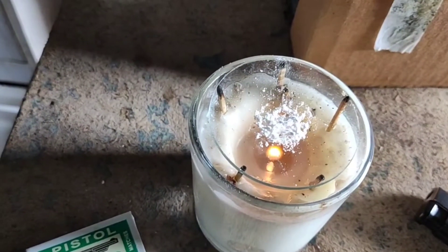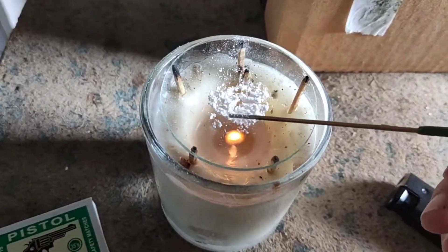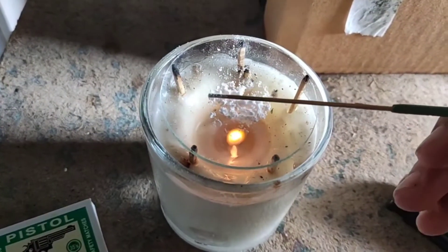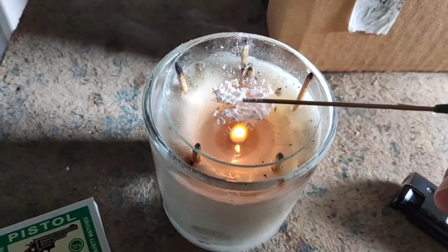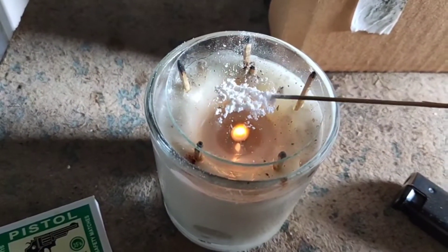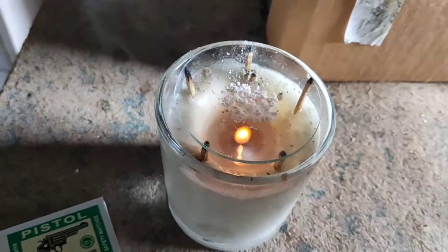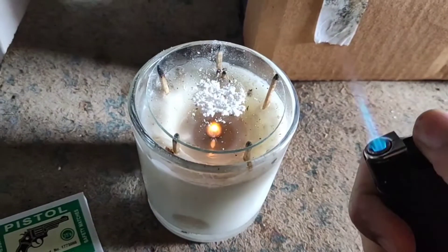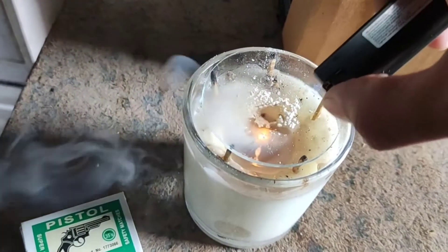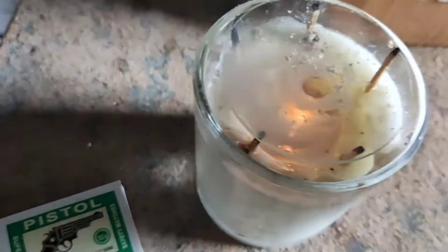You will see in a few moments that vapors will come out of the powder. I would suggest catching those vapors if you want good crystals or don't want to lose your product. I lost my patience and fired it up very fast — you can see everything turned to vapor without turning into liquid, which is what we call sublimation.